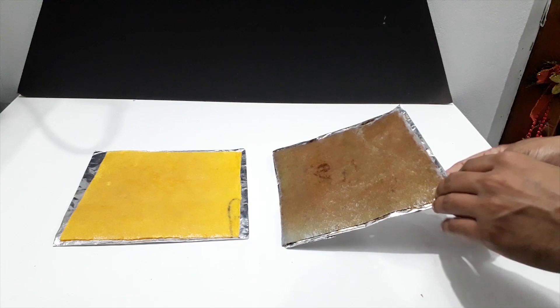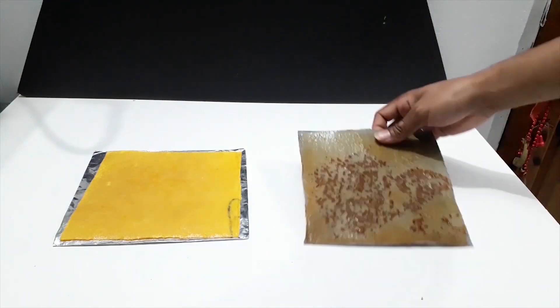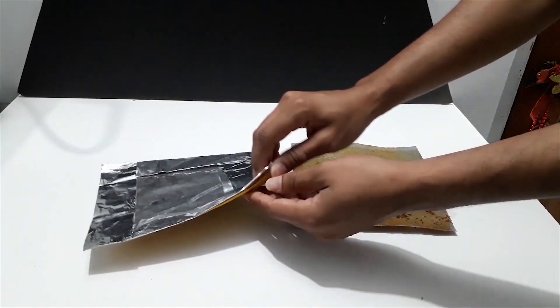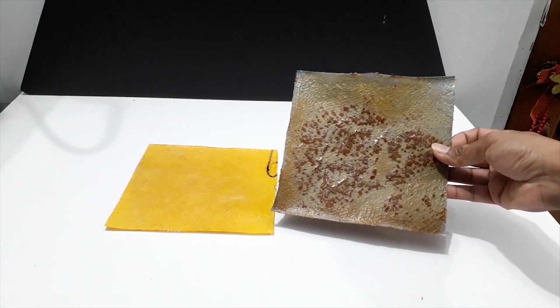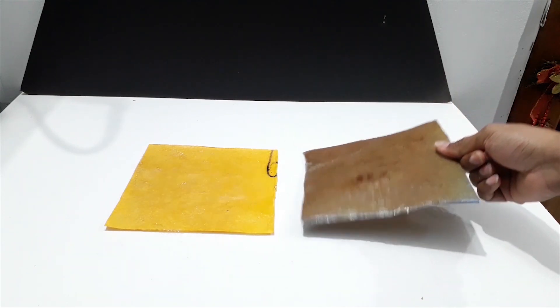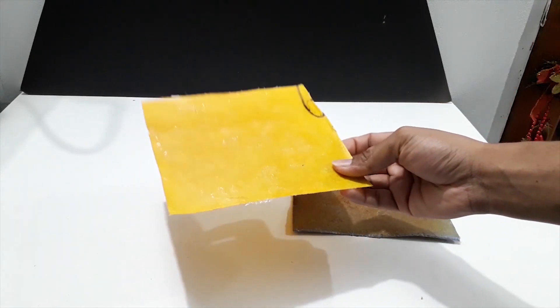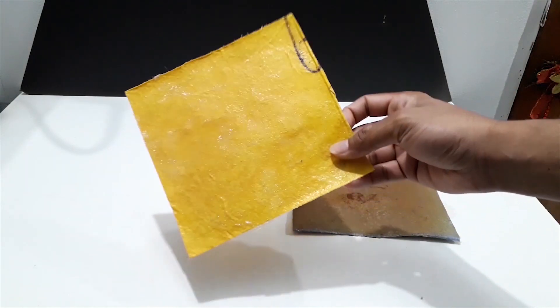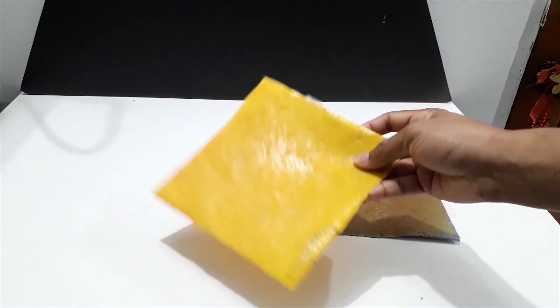Once the membrane is out of the oven, I remove the foil from the membrane. The second membrane is a bit charred and this is because I did not use the thermocouple probe. You can clearly see why it's important to use a thermocouple when doing this. You can see when I turn the membranes, there is a sort of plastic layer on the membrane surface and this is the ion exchange resin.